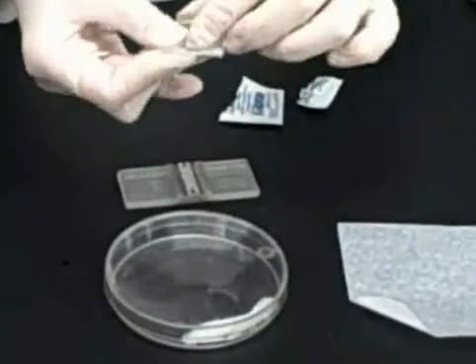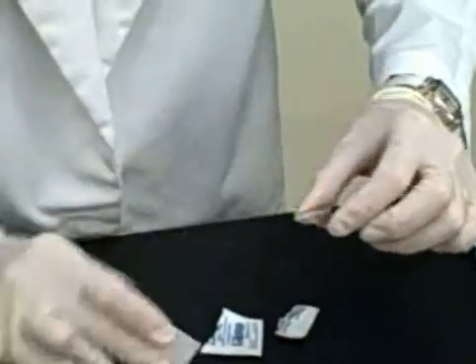Clean the cover slip first, cleaning it well on both sides, and then immediately dry with lens paper.